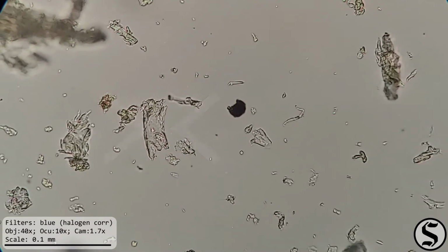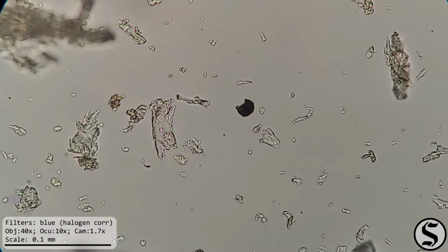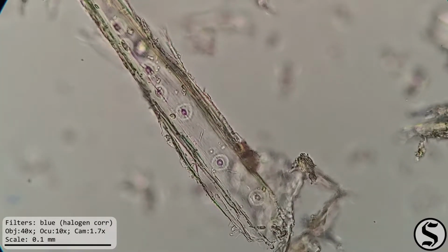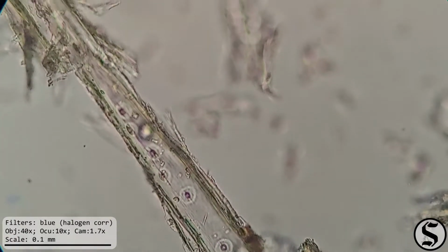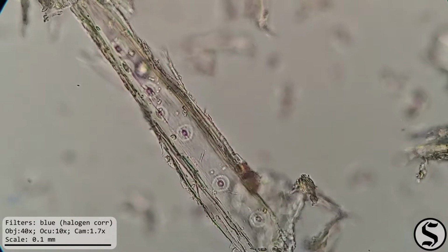Now, interestingly, if you look at this piece, there's kind of a little purple thing in there, and there's a whole collection of them in this piece. I'm wondering if those are the dried up insides of plant cells. I mean, wood is, of course, composed of cells, and when those cells are dead, I would expect them to shrivel up in there and leave some remains.